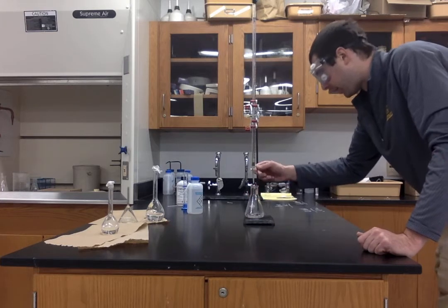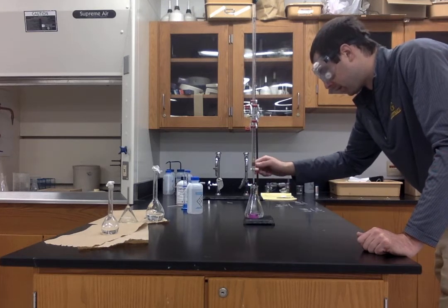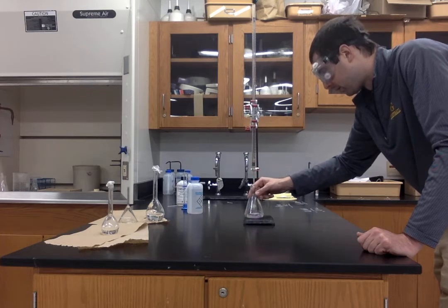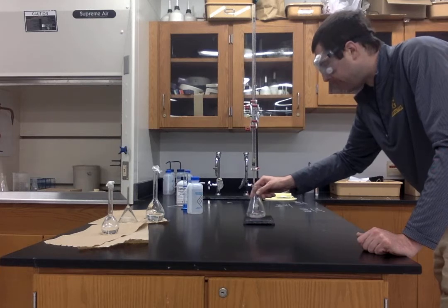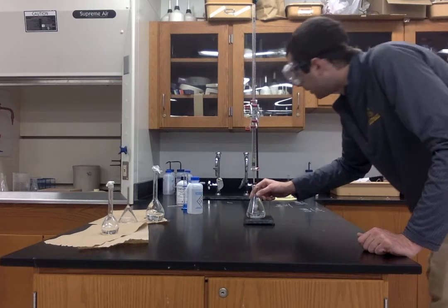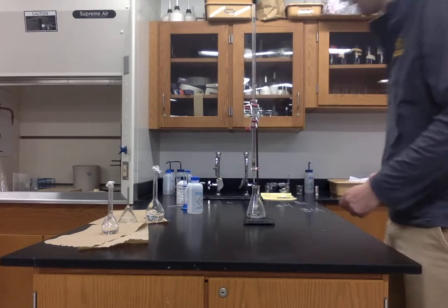Living dangerously right now, ladies and gentlemen. I'm really living dangerously. All right, let's take another pH reading right now.